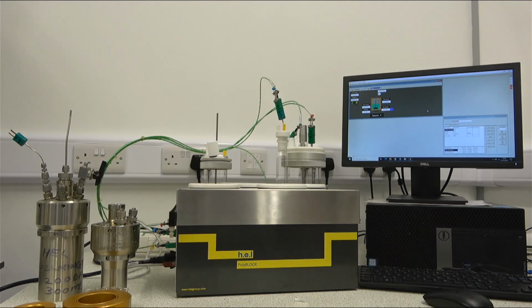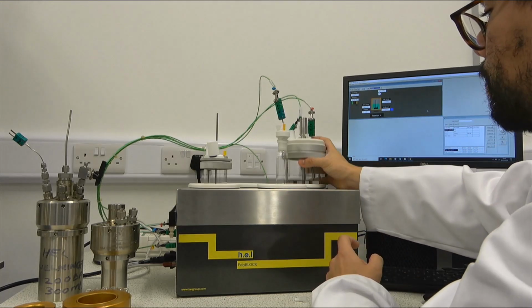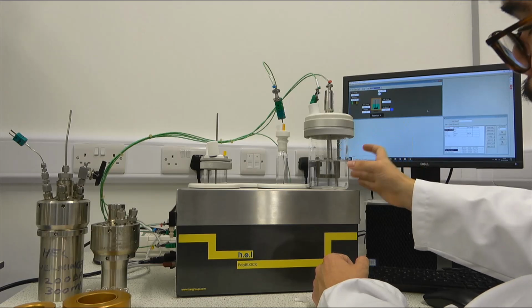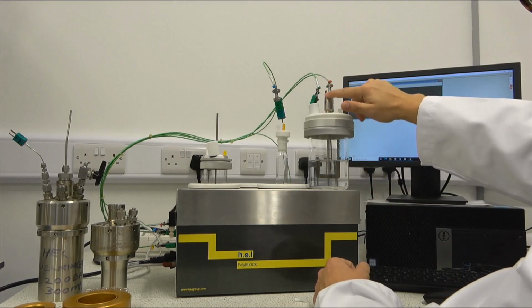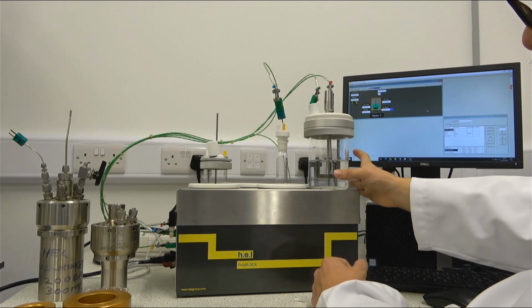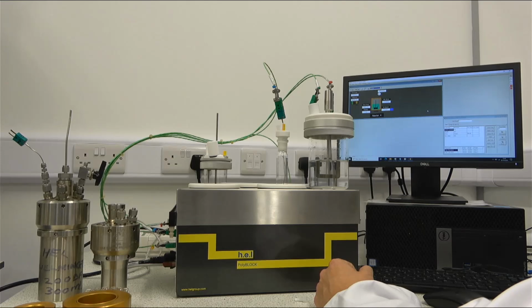Let's start having a bit of an overview of different glass reactors for atmospheric pressure. So we have, for example, this one, which is a half a liter reactor. In this case, we have it connected with direct agitation. As we can see here, this connection would be attached to a motor that will be able to control the agitation inside of the reactor.